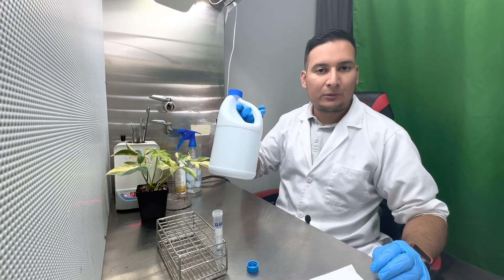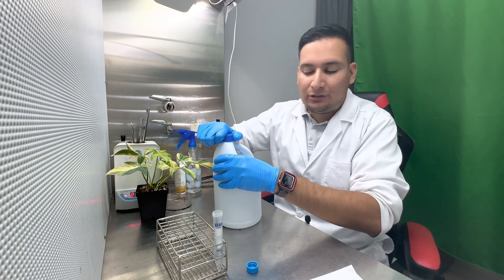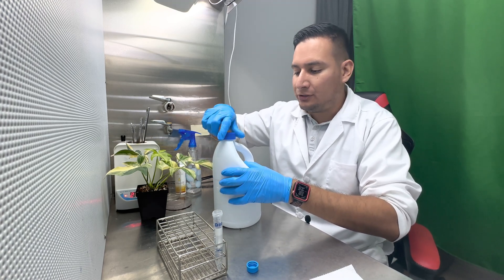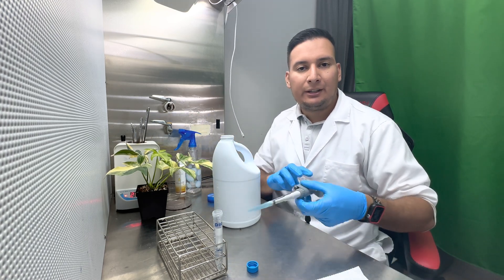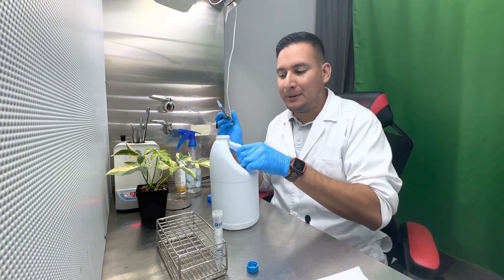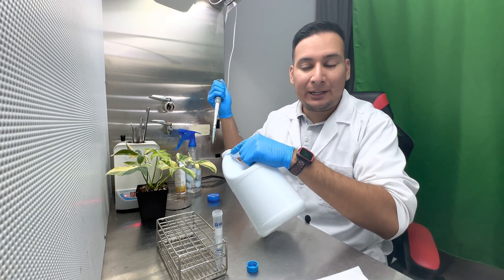Next I want to use commercial bleach, this is just Clorox bleach you can get from the grocery store. I want to add one milliliter of bleach.